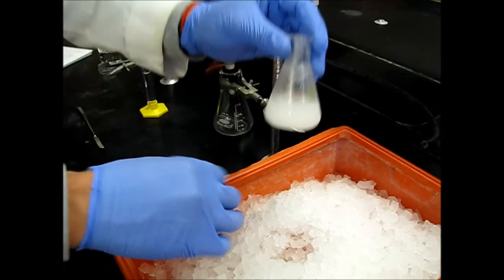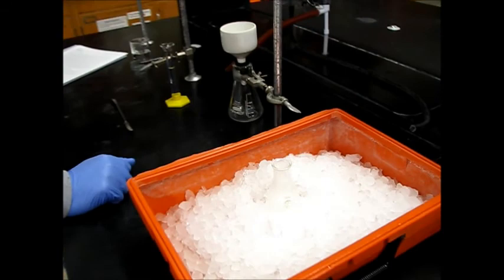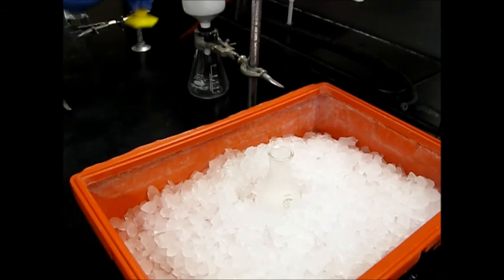So go ahead and put our filter paper in here. So we've allowed this to recrystallize. It took a little bit longer than normal. It was about 15 minutes, but we see some good crystals forming on the sides and bottom of the flask. A lot of white color. So we're going to go ahead and turn on our suction. It's all white precipitate.